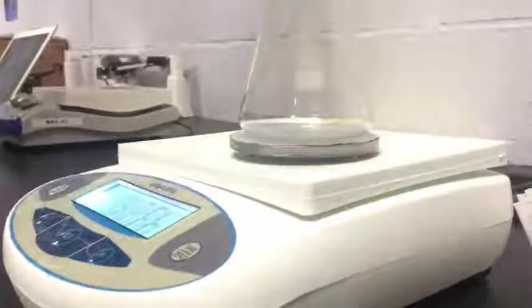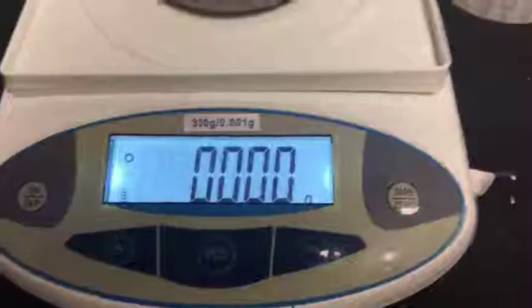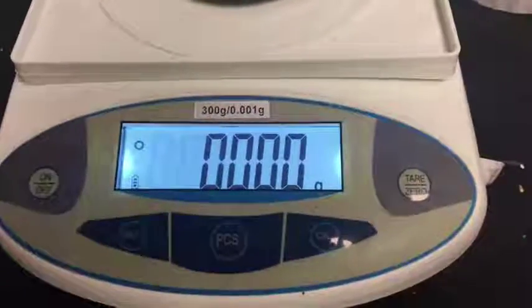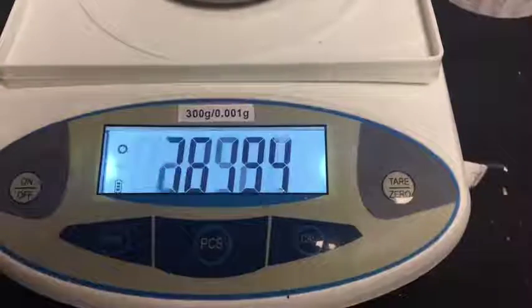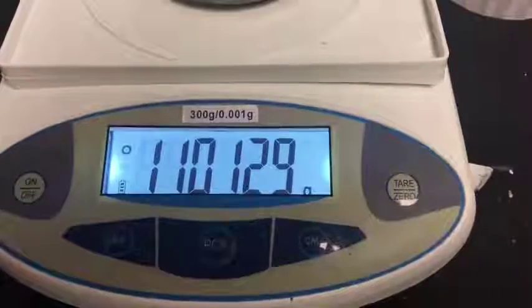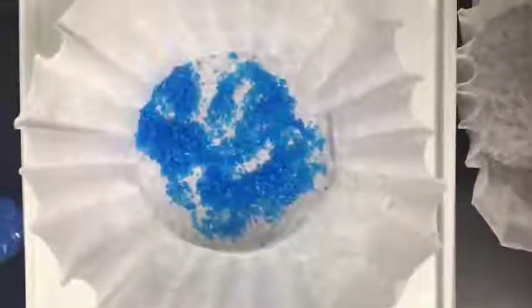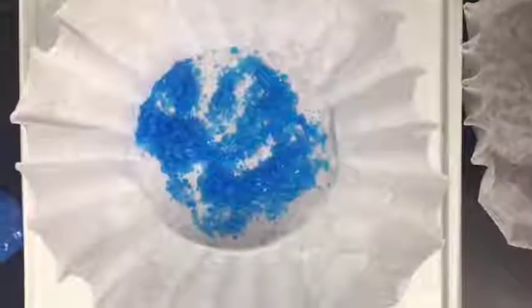Hi, I'm Georgia Goldstein, and today we're going to be performing a science experiment to find out how much water is lost when we heat hydrated copper sulfate. So first we're going to look at our material checklist to make sure we have everything we need, and then we're going to put on our gloves and our goggles so we can stay protected, as there will be a chemical reaction occurring in this experiment.